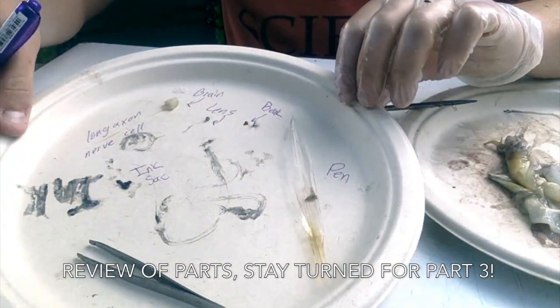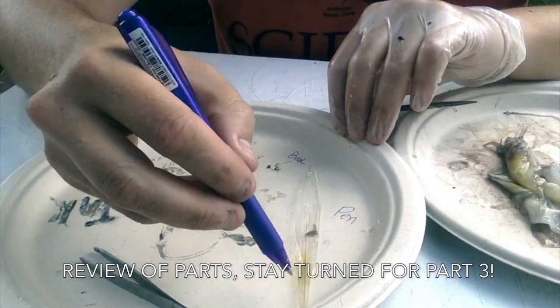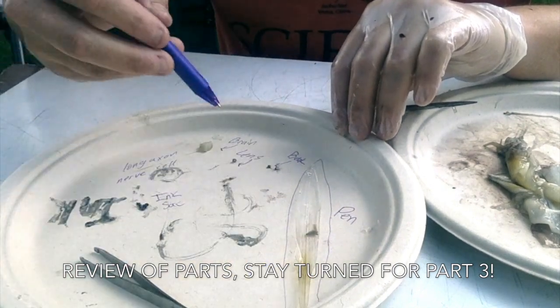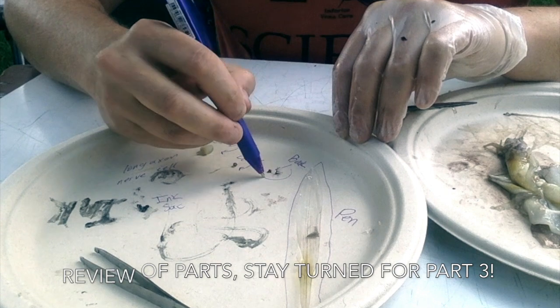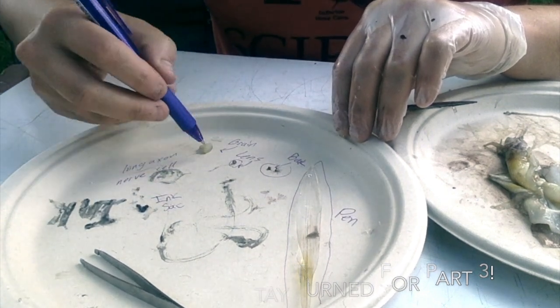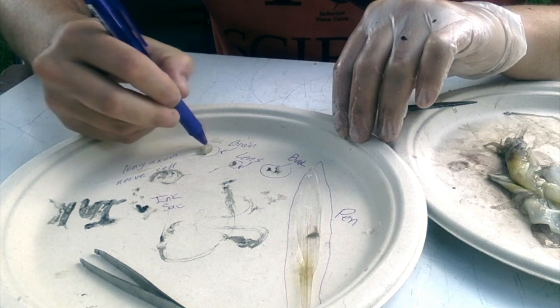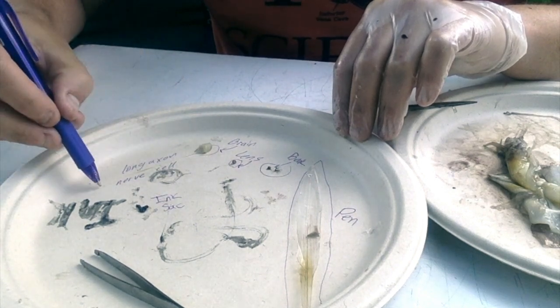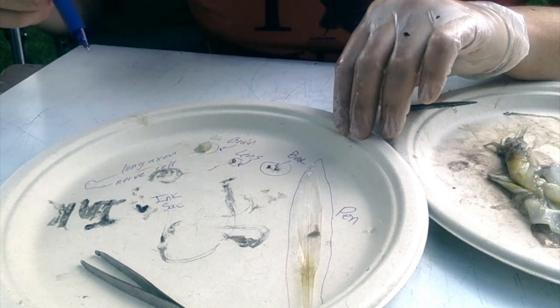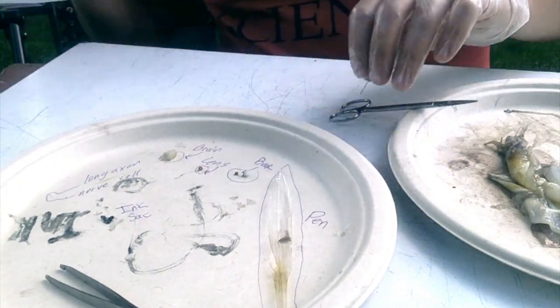And so here's our little collection of different items that we have. The pen's really long. The beak is very small. The lens is tiny. The brain, this mass here, this is the long axon all the way down to here. That's actually a great specimen. I'd love to get that under a microscope.